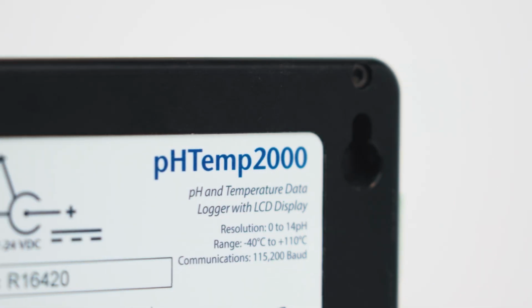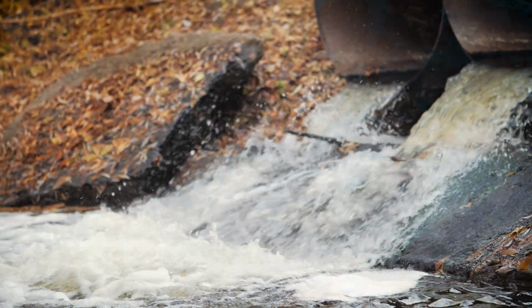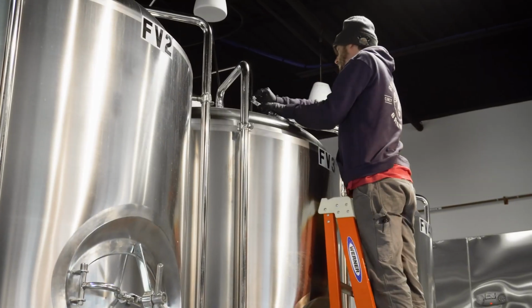The pHTemp2000 is a pH and temperature data logger that can be used in a wide variety of applications, including surface and groundwater quality monitoring, industrial influent and effluent, environmental and wetlands monitoring, and much more.